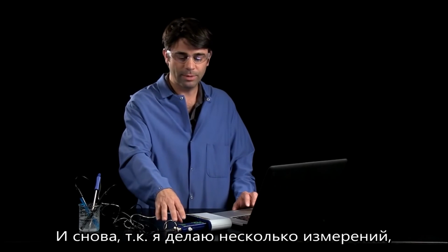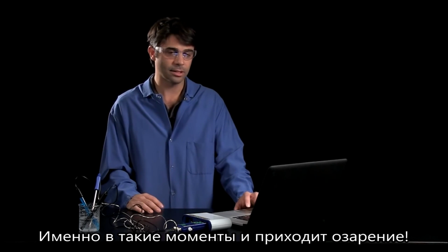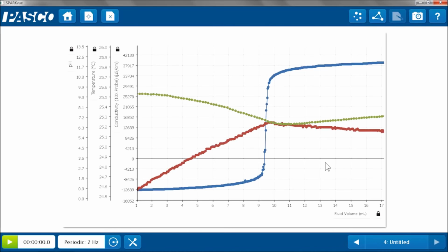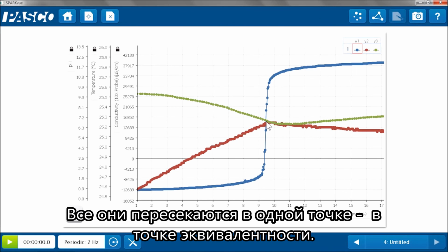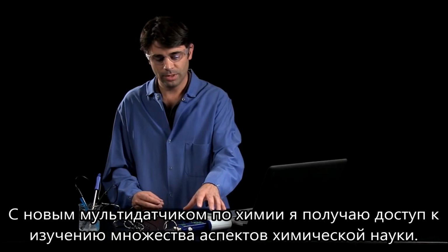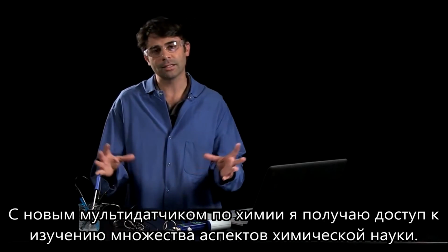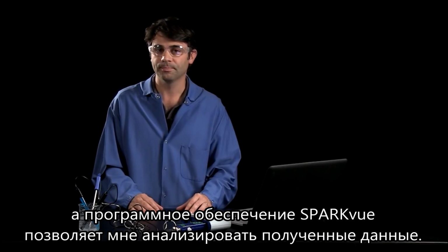And again, because of the multi-measure nature of this, I can look at all those things simultaneously. And this is really where the big ideas can come together. So here's my graph of pH, my Y1, temperature, my Y2, the red one, and conductivity, the Y3. And I can see they all meet up at the same point where the equivalence point was reached, and that's where the inflection points for those graphs were. So with this new Advanced Chemistry Sensor, I can have access to lots of chemistry concepts, both individually and simultaneously, because of the measurements I can make, the software I can use, and the analysis that I can do.